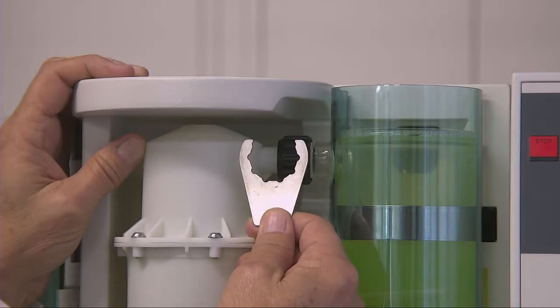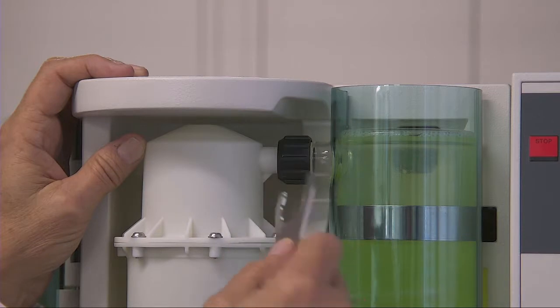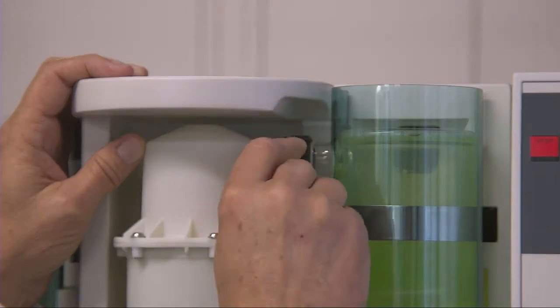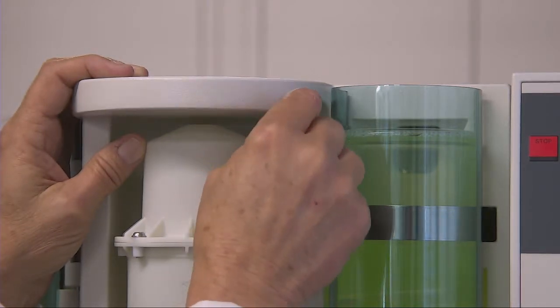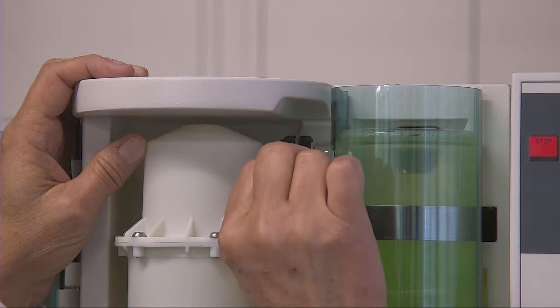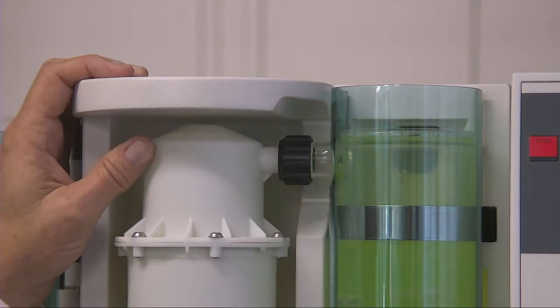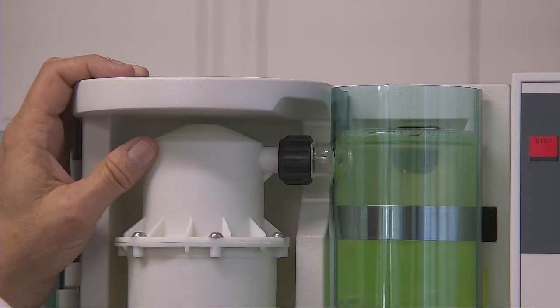The tool part number is 1105-7779. You can order that from BUCHI. That tool is built so that you can tighten it very tight without breaking the condenser. As you can see, this is loose. I'm tightening it, but I'm not over tightening it. Please do not use pliers on this. The only thing that will result in is breaking this glass connection.